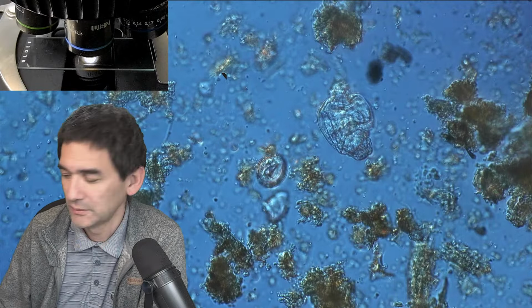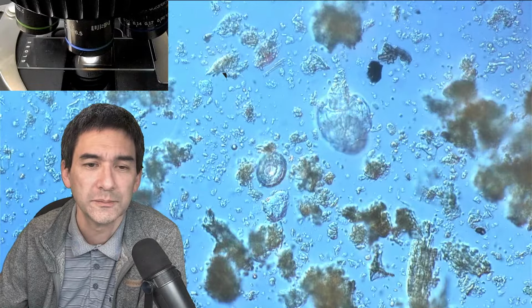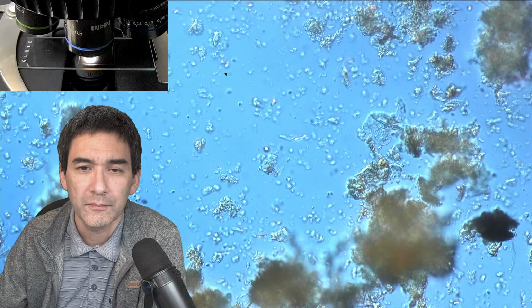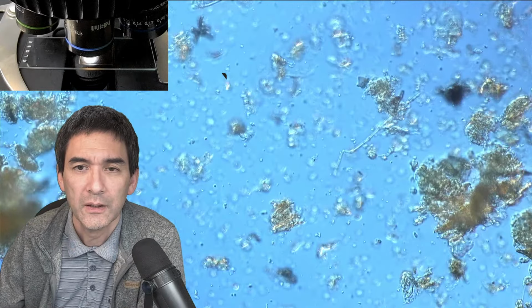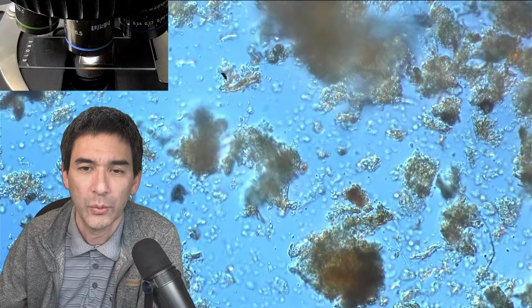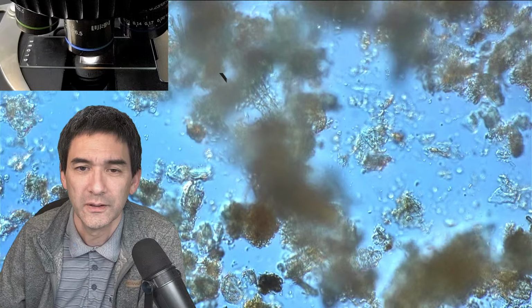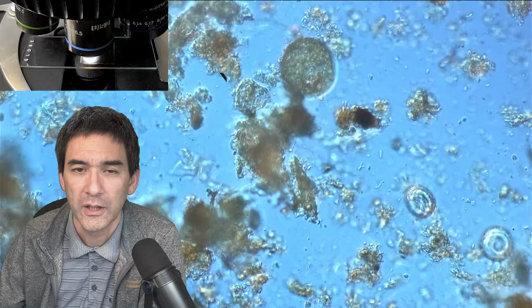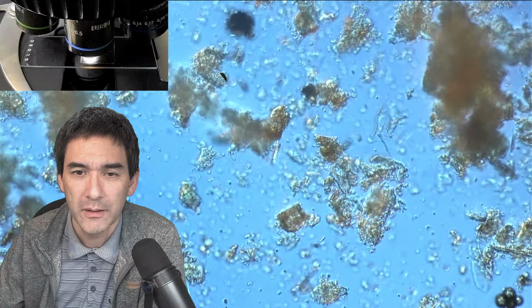Here we go. Let's open it a little bit. Yeah, that's an interesting one as well. Usually the amoeba, as I said, move quite slowly. But when you have them in time lapse, it can be quite interesting. So maybe we're lucky, maybe we're able to find one or the other. Amoeba are, per definition, microorganisms. They're single-celled, but it's a little bit of a question of definition here. Lots of these shells are called tests. Testate amoeba.